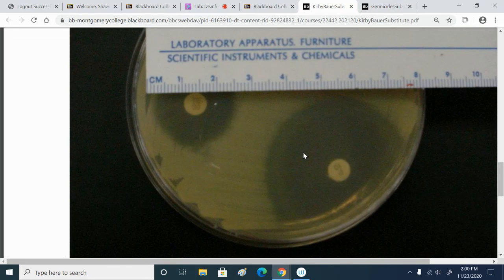Even if we refrigerate the plates, still sometimes we see some of the growth encroaching in on the original zone of inhibition. But if you had measured this in 24 hours, it would have been the original outer zone. So that's what we go by.